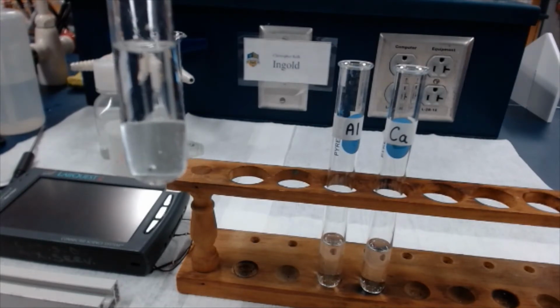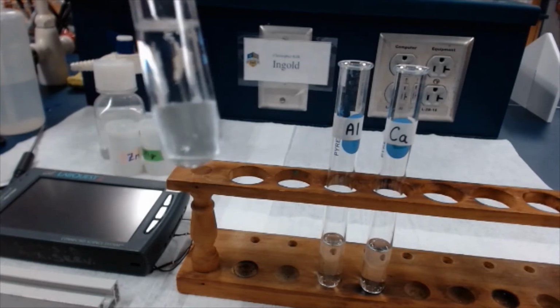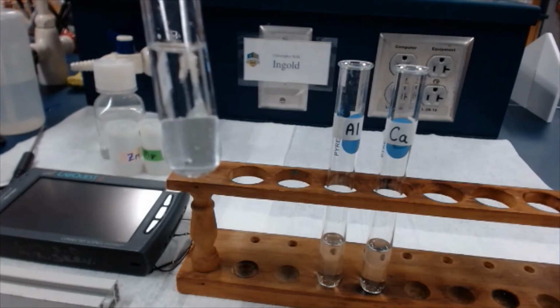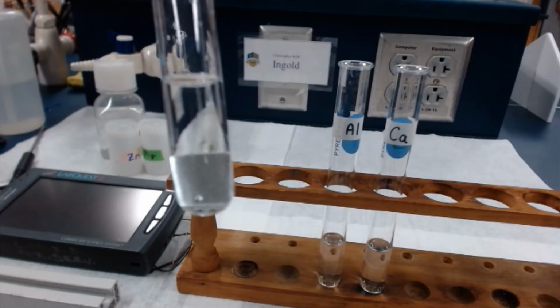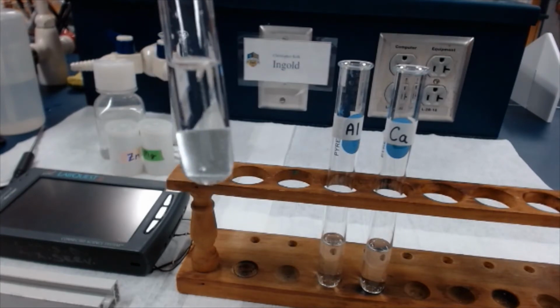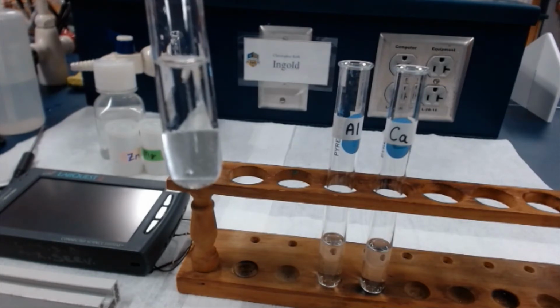Not very much happening, although I think maybe you can see that a small bubble has formed down near the bottom of the piece of zinc. I'm not sure if you can see, but look along the top edge of the zinc. Oh, a little bubble just flew up. Along the top edge and the bottom edge of the zinc, again maybe hard to see on the camera, I see a few tiny little bubbles forming.